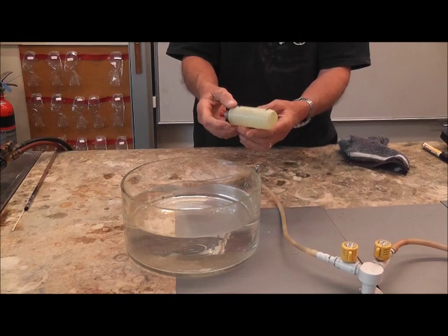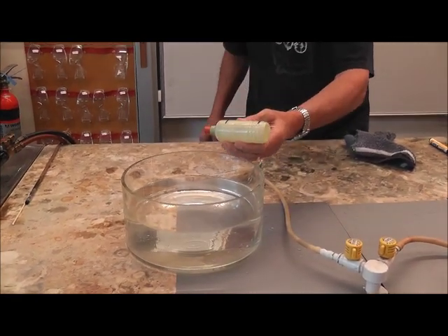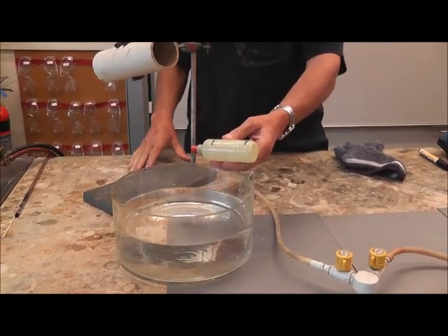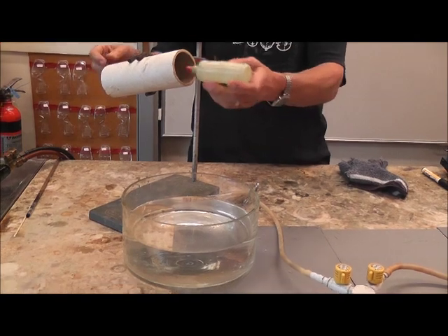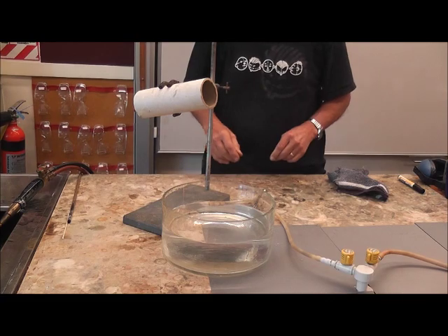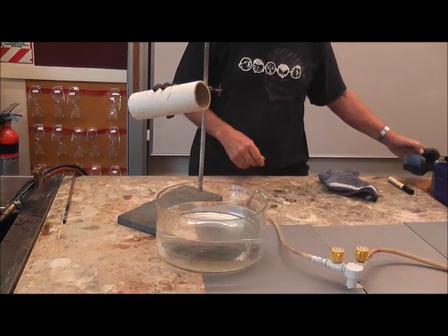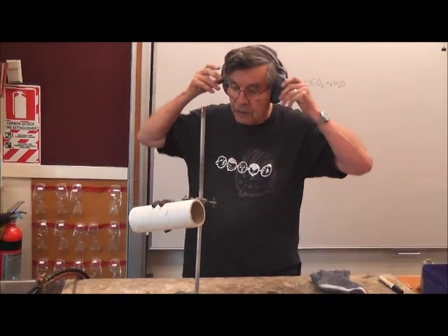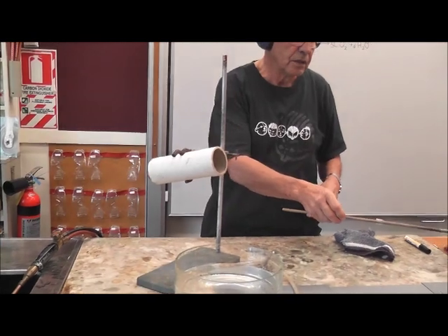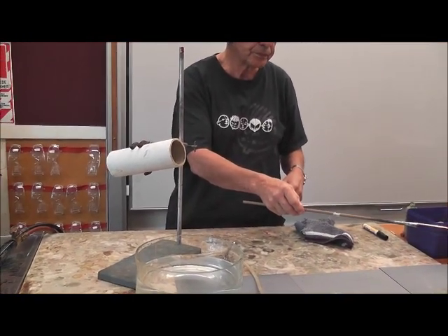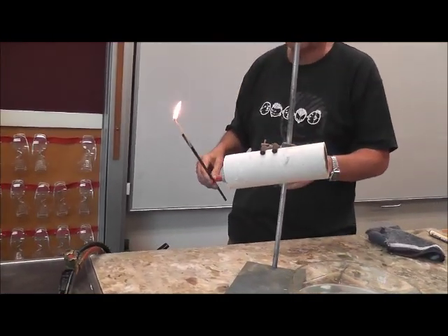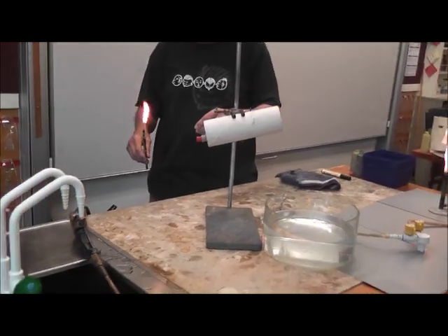Now to deal with this experiment and to light it, we're going to be a little bit more careful. And I'm going to place this thing into a launching device. So we have a tube here. We'll pop this into there because I do have a feeling that the reaction is going to be better this time. And because I'm so close to it, I'm going to use these this time. And I'm going to use a wick to light this. And so we'll proceed to light this particular material as soon as we're pretty much ready.